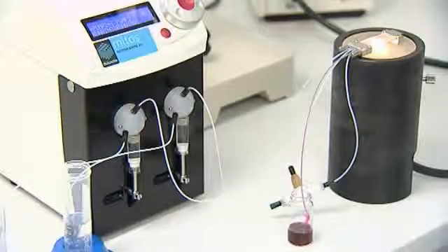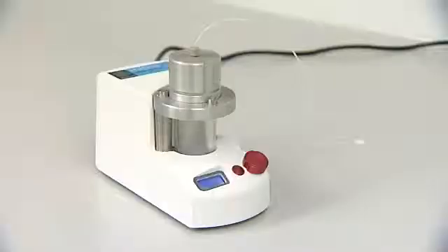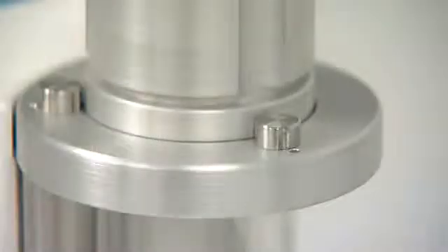Here a dual channel syringe pump is used to give accurate flow rate and automated control.